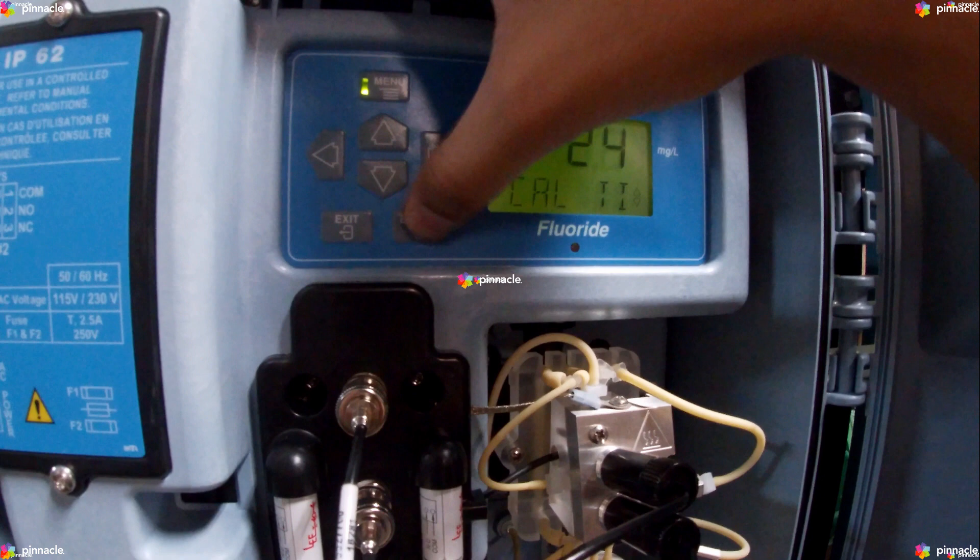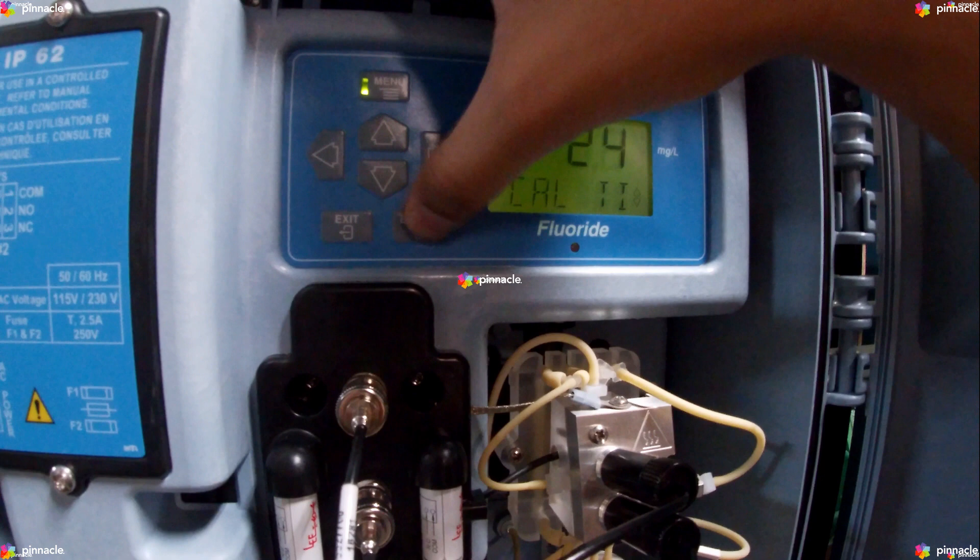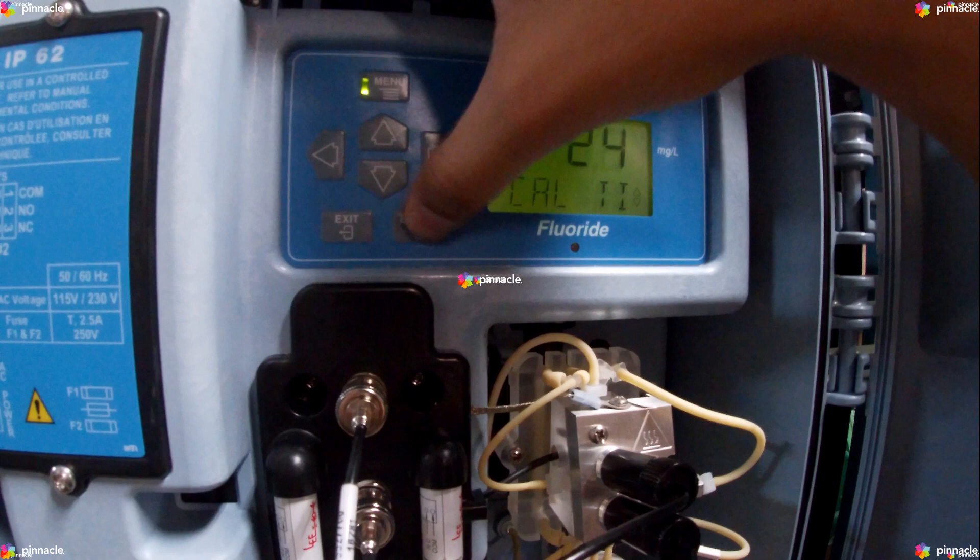The Offset option shows the current offset correction factor. This factor is calculated during the calibration. The typical values are between negative 100 millivolts and positive 100 millivolts.